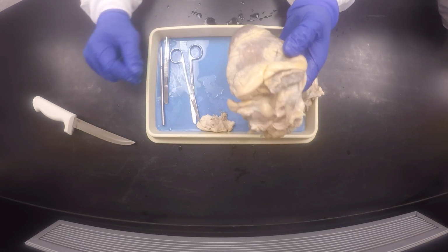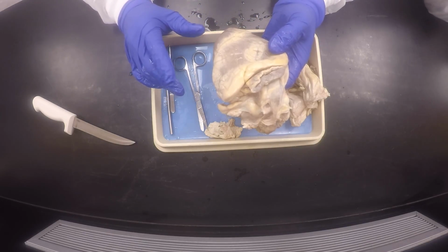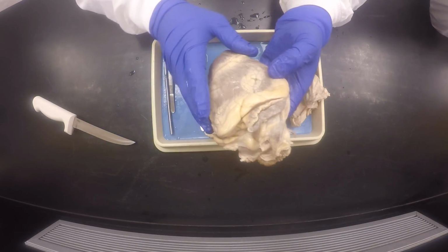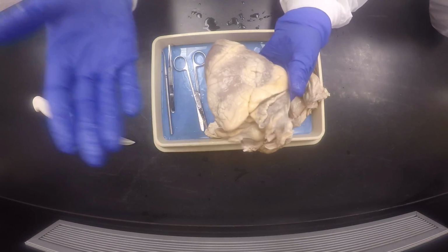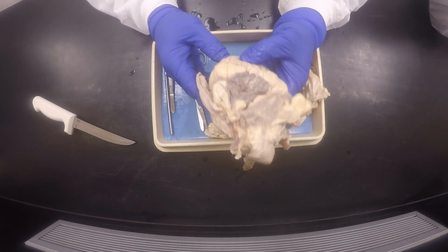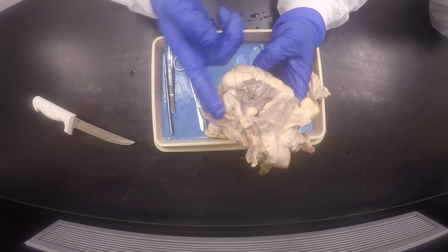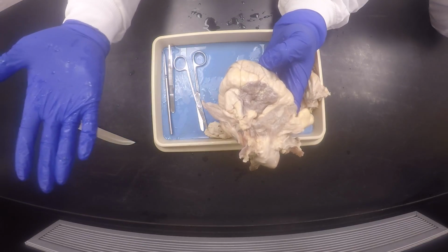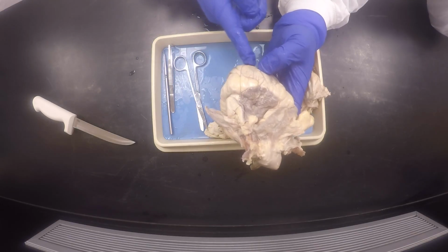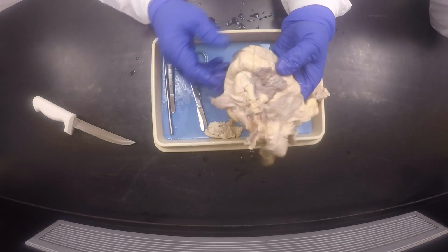Okay, so one of the first orders of business, we use this diagonal indentation or sulcus, or sort of crack, if you will. Sulcus is the name for it, or groove. Make sure it's sloping from top right to bottom left. Okay, and this looks like it. Right here, you see how it's sloping from, well, on my right here, which is the left of this, and going to my left, but the right of it. You know what I'm saying?